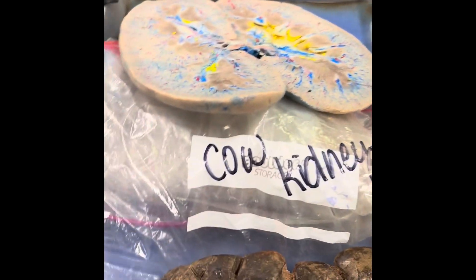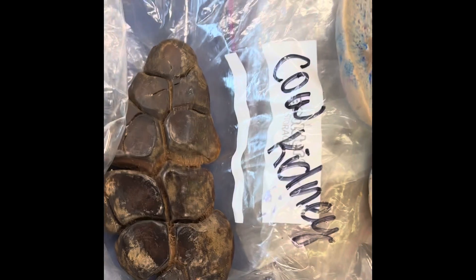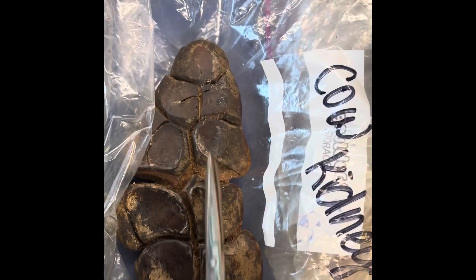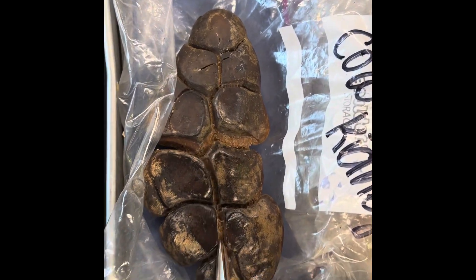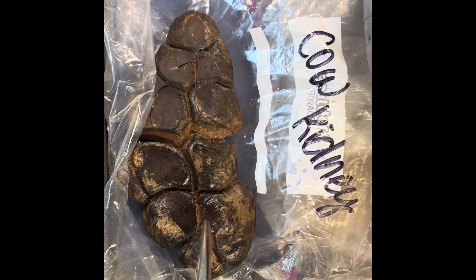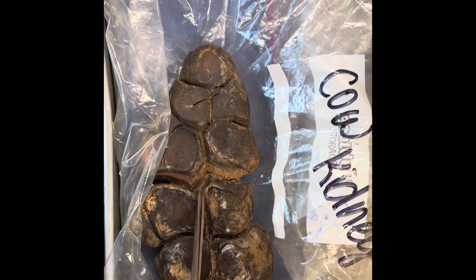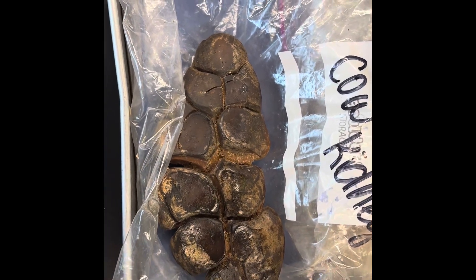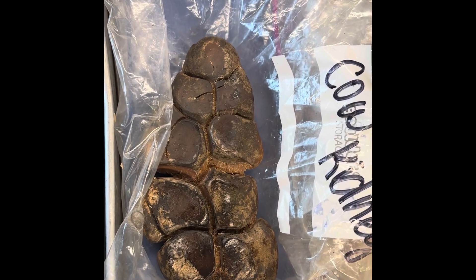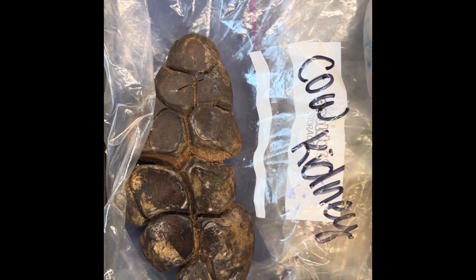Over here we have the cow kidney. It's the species that has a lobe type kidney, different than the bean shape of other species.